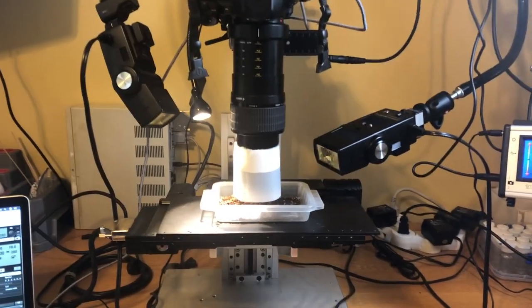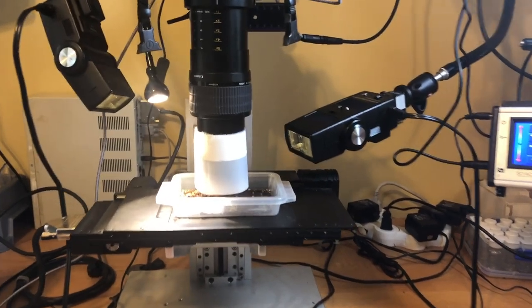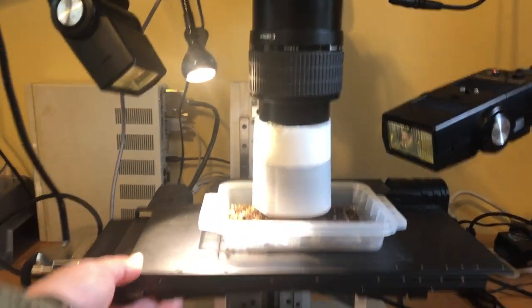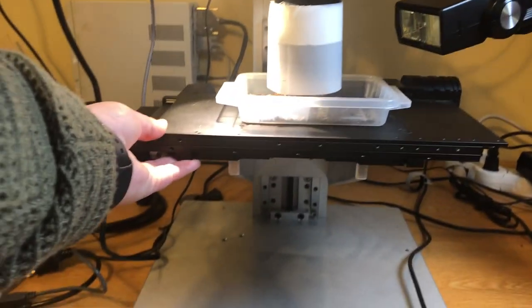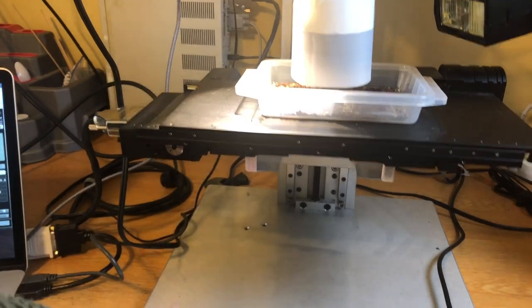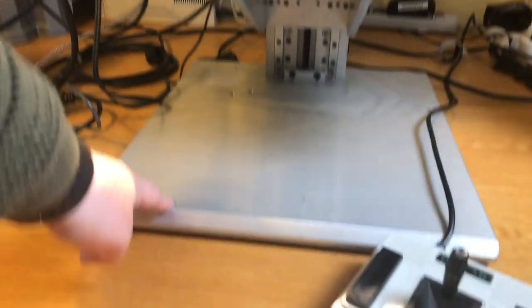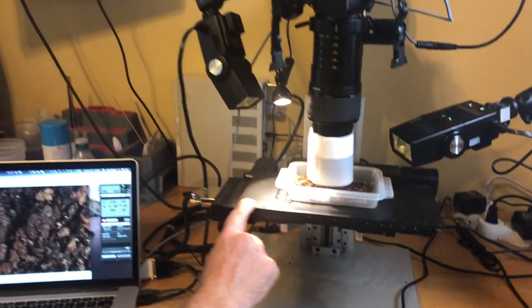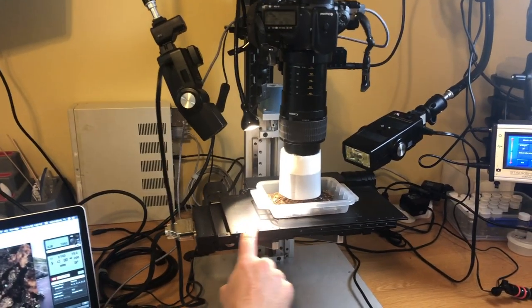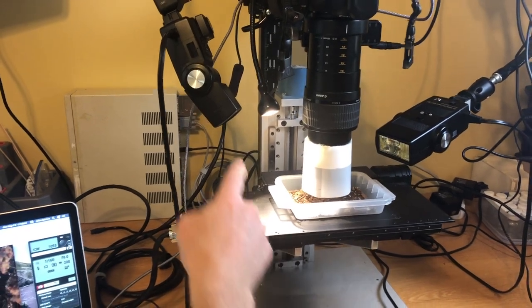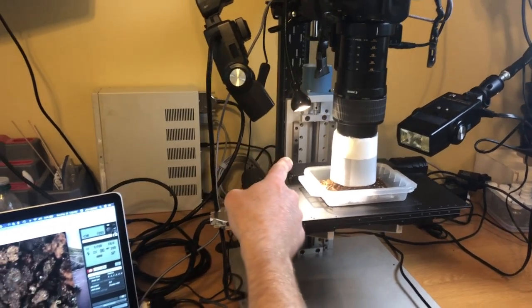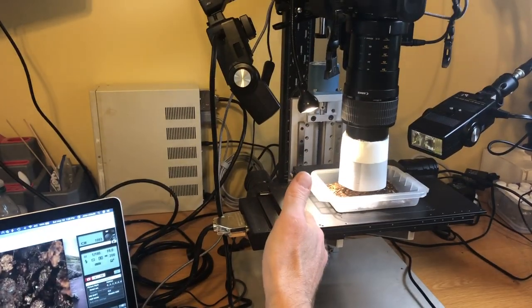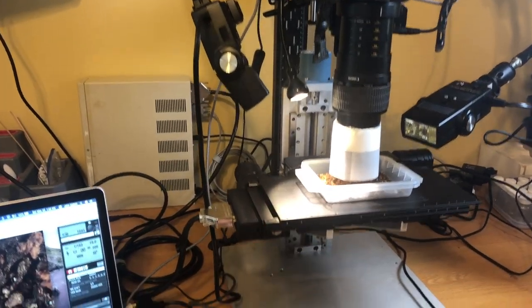To be clear, it's just this black part here, it's just this. This part here is an XY stage that's mounted on a Z rail, Z axis rail back there.